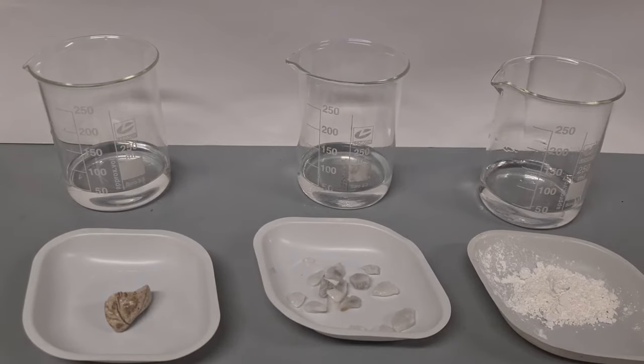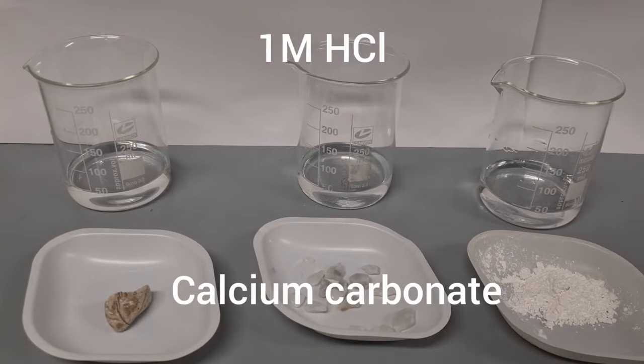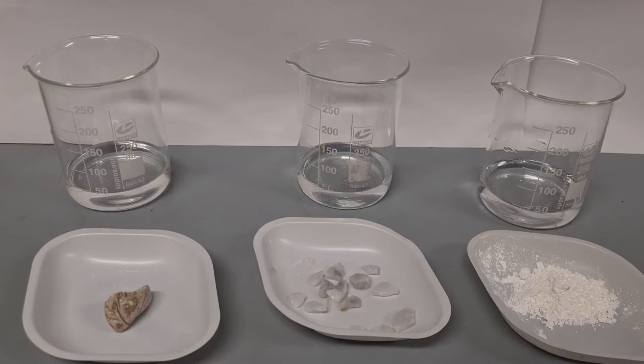In this video, we're looking at the reaction between calcium carbonate and hydrochloric acid. Each beaker contains one molar concentration of hydrochloric acid. Each tray contains 10 grams of calcium carbonate.